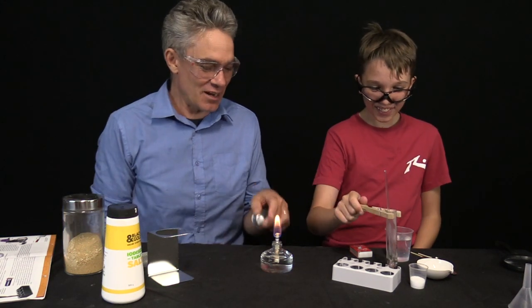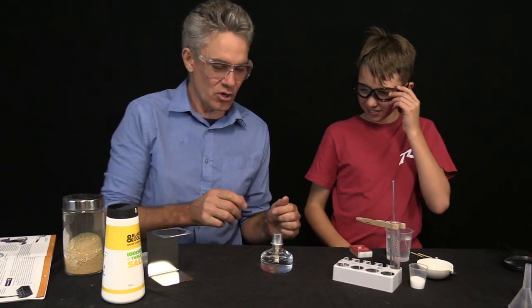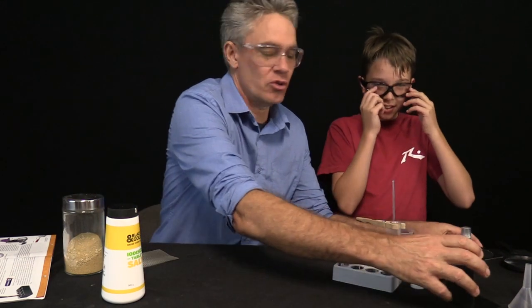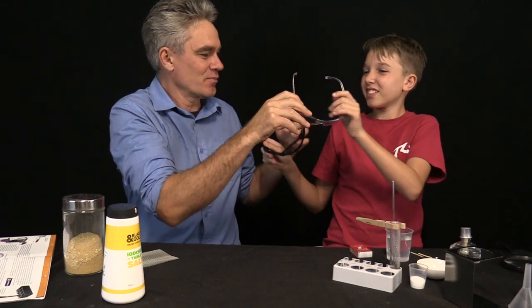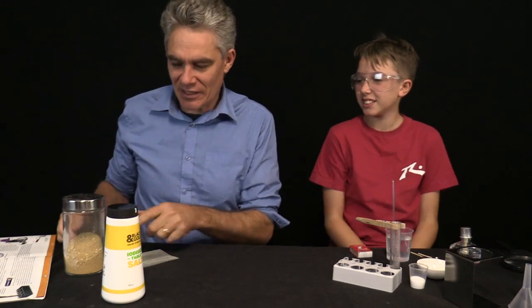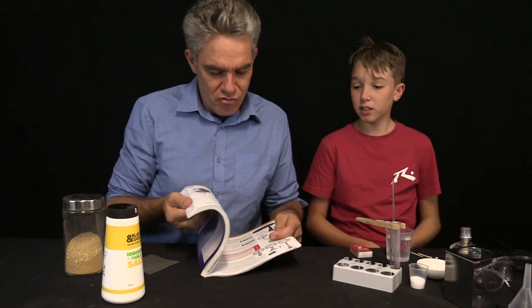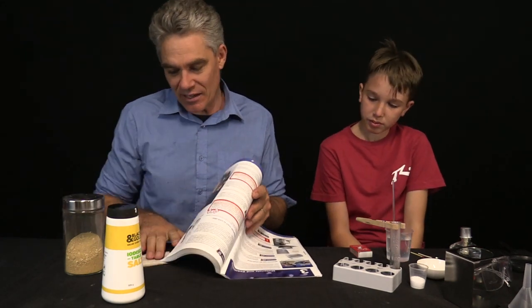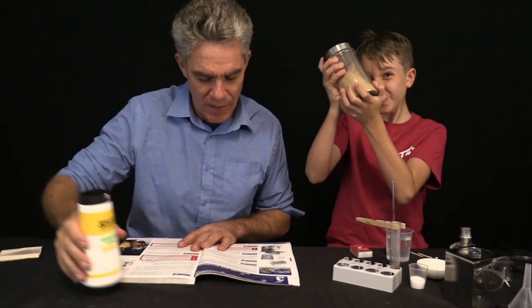Now, you never heat a dry or an empty test tube because the temperature goes up too high and it will crack. And it's very likely to crack. Exactly, Sam. Someone's been teaching you good science already. I wonder who. Now, do you know how to put this out? I think you put this out by putting a top on like that. Good. So that was experiment one and two.